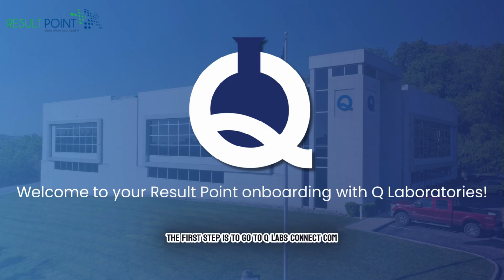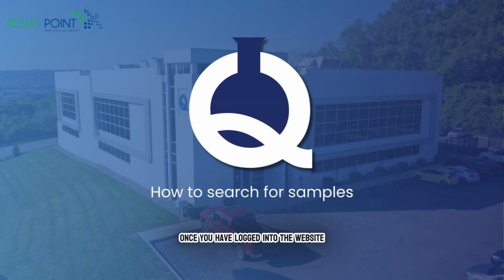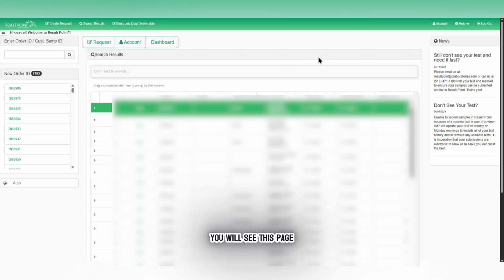The first step is to go to qlabsconnect.com. This brings us to the login page, where you will enter your username and password. This information should have already been provided to you by an employee at QLabs. Once you have logged into the website, you will see this page.